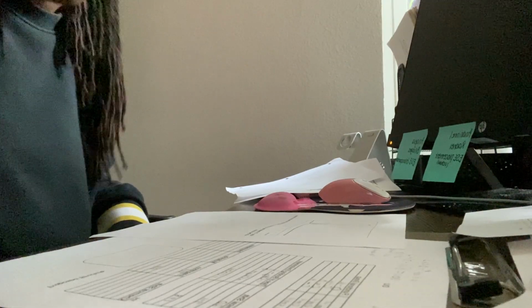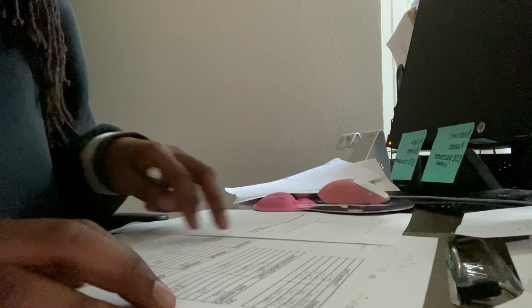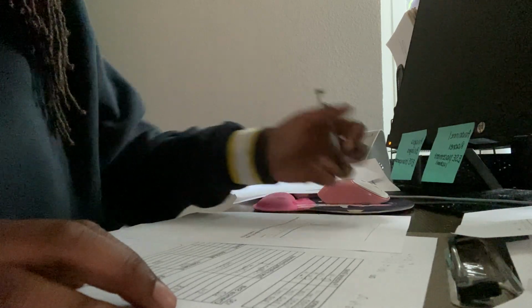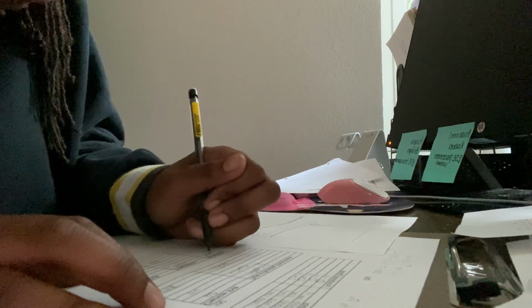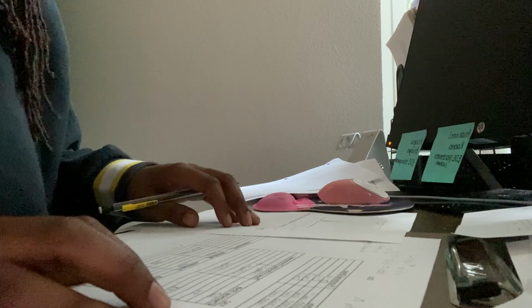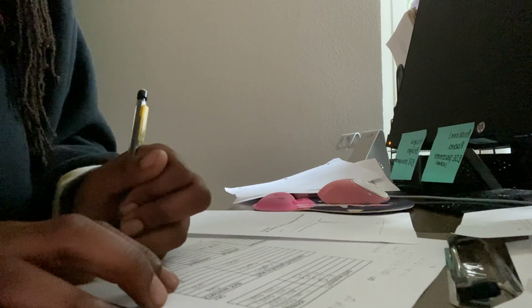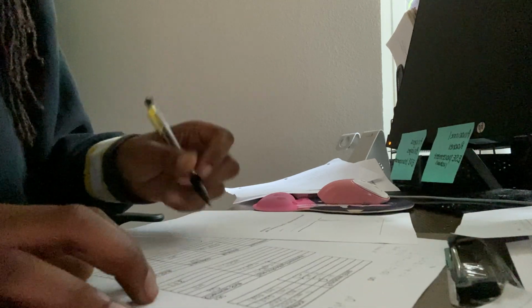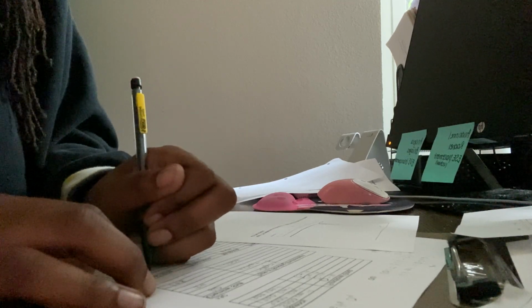The multiplicities are important. And so yeah, we're on the 1H scale. Once we determine the multiplicities for the scale, which isn't hard because you look at the table, the 4H, 1, 2, 3. This is triplet. This is pentet. And again, this is going to be important for the determination. But we're going to look at the chemical shift now. This appears to shift based off of the graph right here at 1.90, and 4H further down is about 2.43, maybe 2.5.